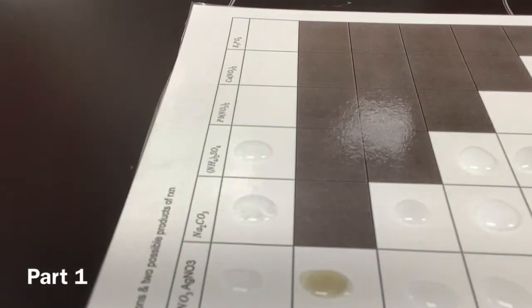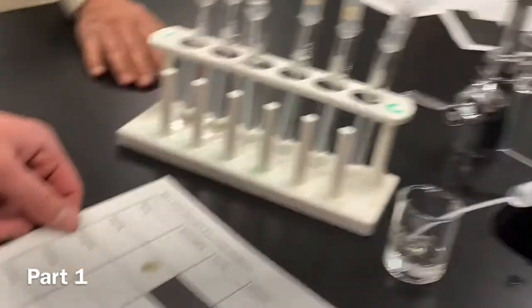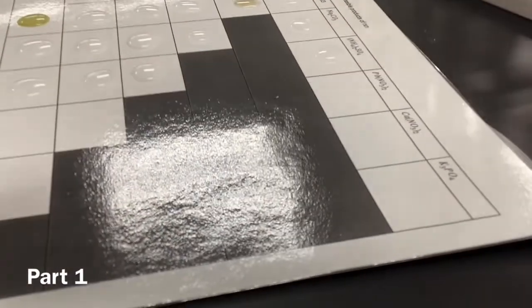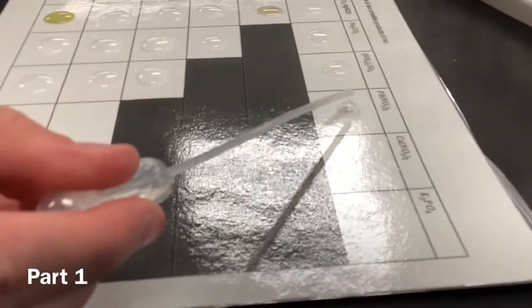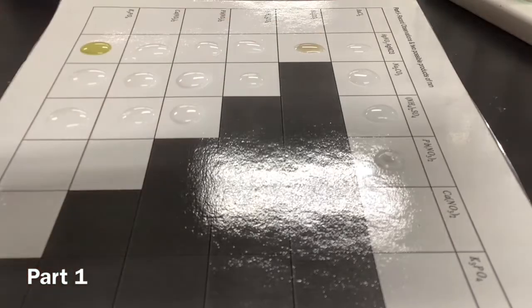So this right here is called iron(III) chloride. There's also iron(II) chloride. You might have to pick it up. Let's see, can we just flip it to this side? Yeah, that's a good idea. All right, close your eyes if you get motion sick. So is it always gonna be iron 3 though? So when this particular compound reacts, it's always gonna be a 3. If it was the iron(II) chloride, then it would always be the 2. Does that make sense?